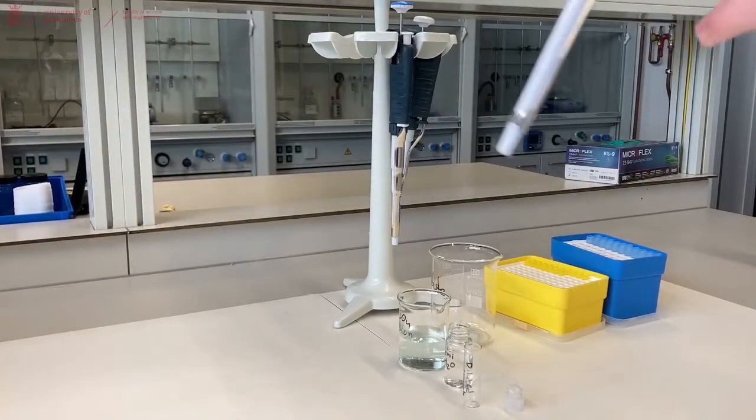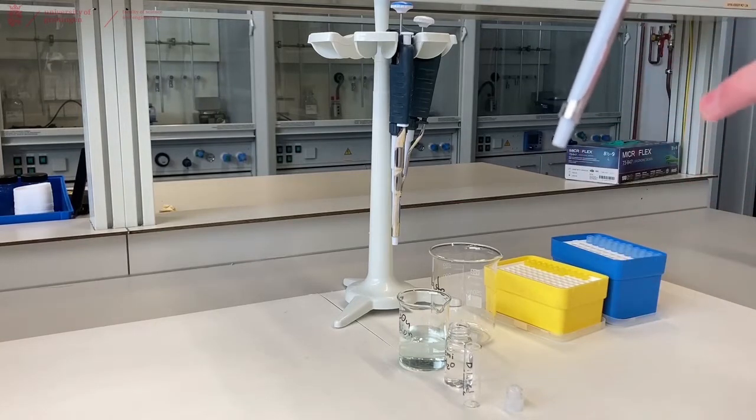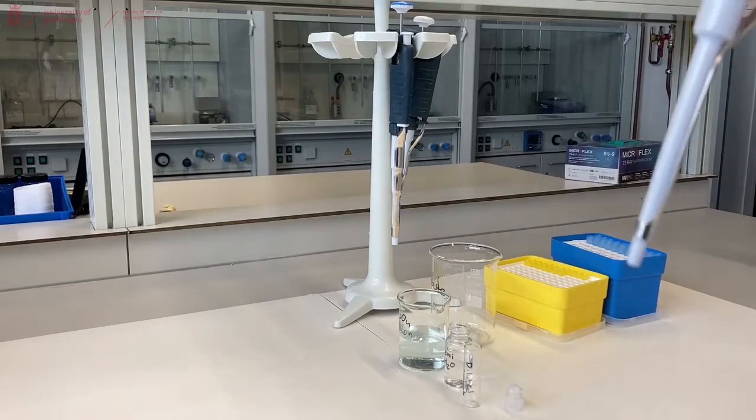Before we can use the pipette, we have to make sure we're actually pipetting into a pipette tip, because if we use it without a tip we're pipetting directly into the mechanism and it will slowly break the pipette.